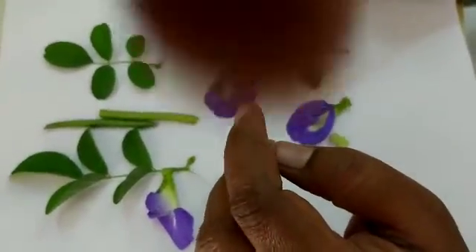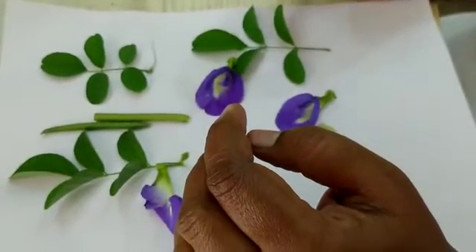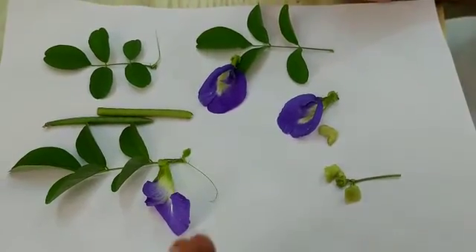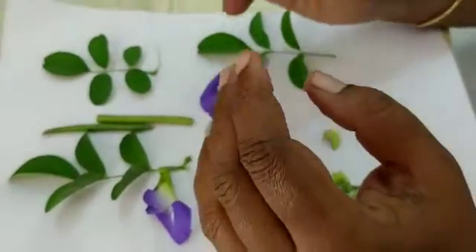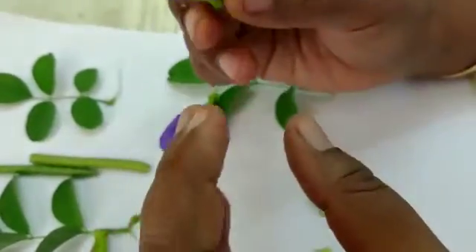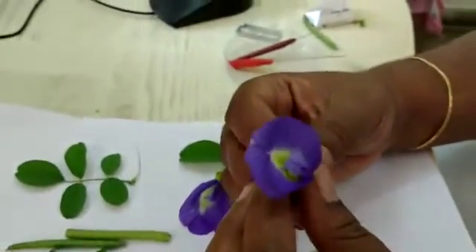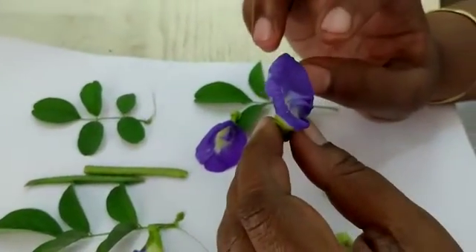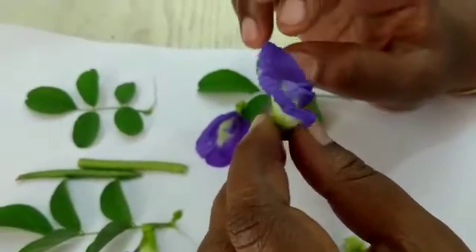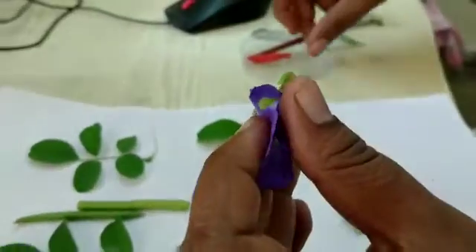Good morning children. Today we will see the flower dissection of pea flower. It belongs to the family Leguminaceae, also called Fabaceae. In this family, the flowers have a stalk, so it is a pedicellate flower. It is also a solitary flower, purple in color. The member I am showing is Clitoria alba or Clitoria violacea, since it is violet in color.